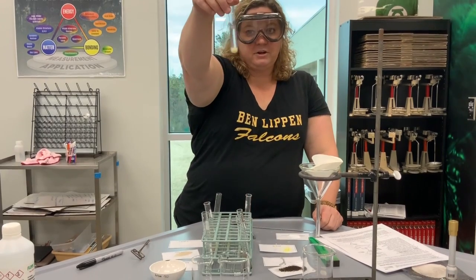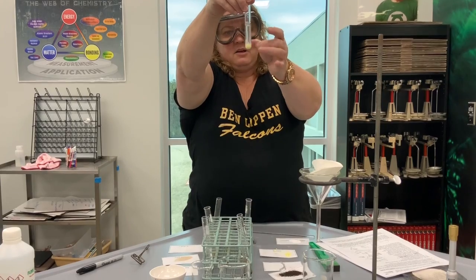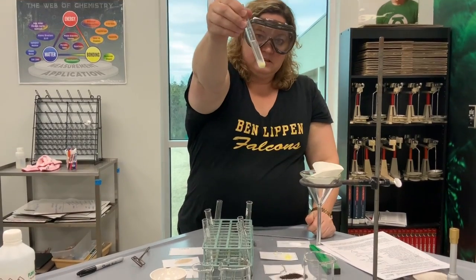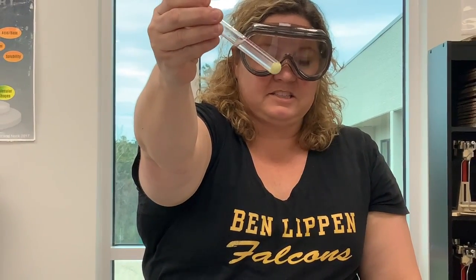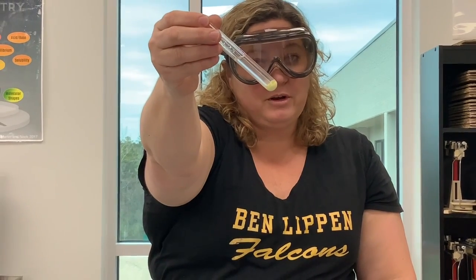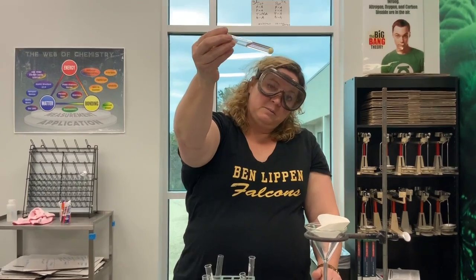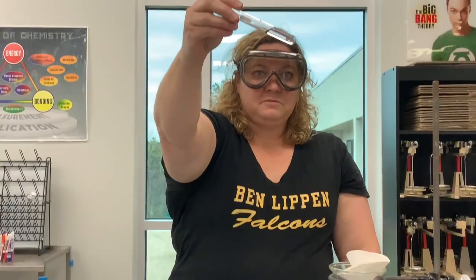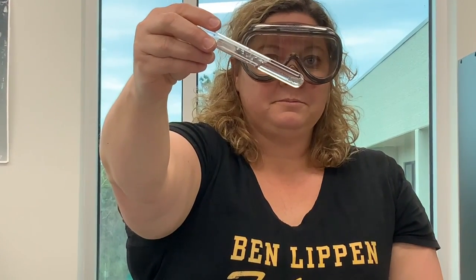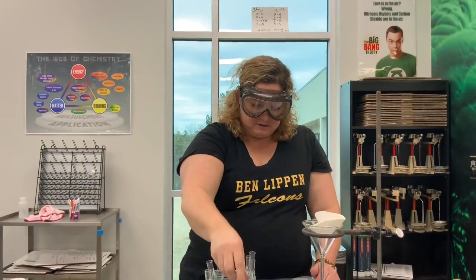So this is our sulfur, and as you can see, not a whole lot of dissolving. So the particles are staying uniquely themselves, the water is not changing. So we might have some smaller particles floating within the water, but it is not dissolving. So a little bit of a physical change, not much. The magnesium, you see it at the bottom? So magnesium has not changed at all, it did not dissolve.